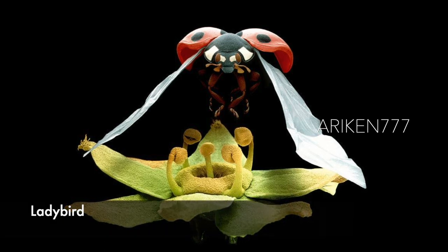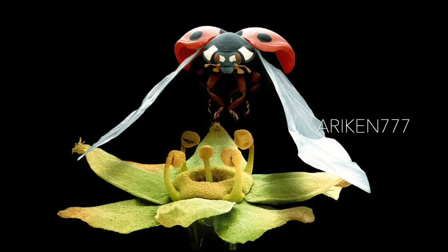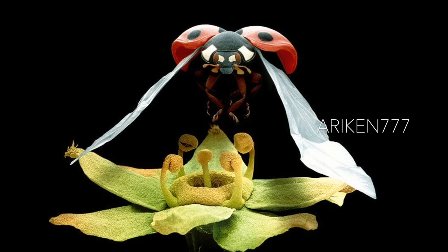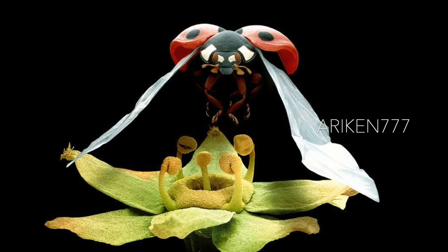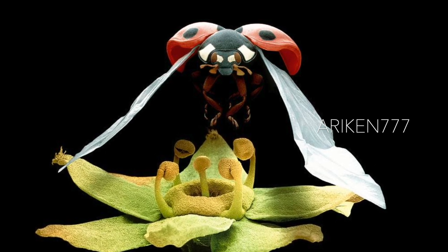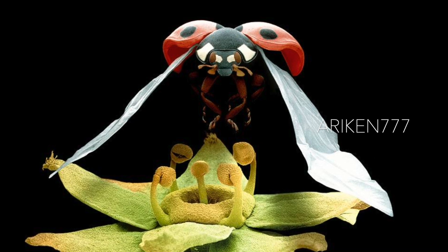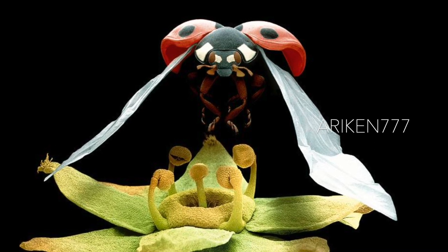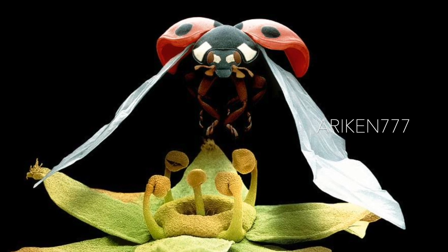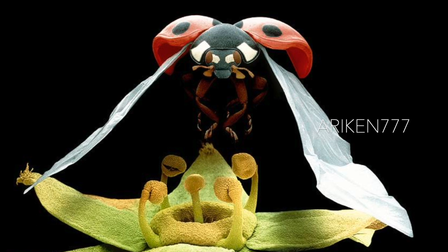A ladybird in flight. This is a seven-spot ladybird beetle flying over a flower. The outer wings of the ladybird are strengthened into a hard covering called the elytra, to protect the delicate flight wings found beneath. These elytra are raised in flight while other transparent hind wings propel the insect. Seven black spots are found on the red wing covers of this ladybird. The red and black colors are a warning to predators because this beetle is able to squirt distasteful fluids.